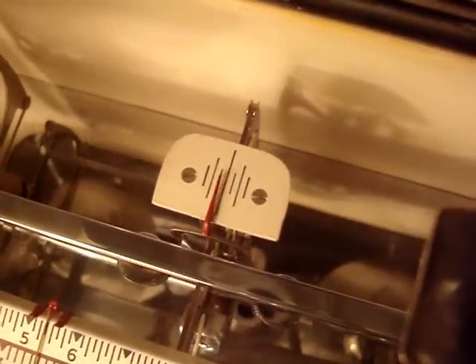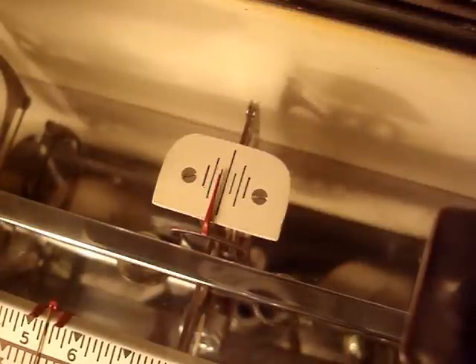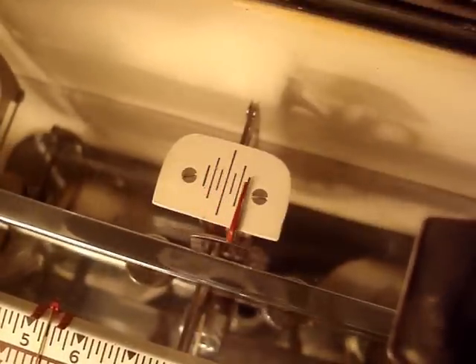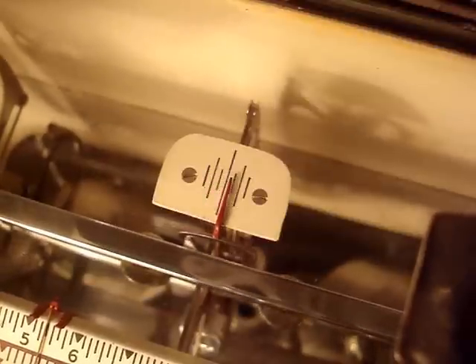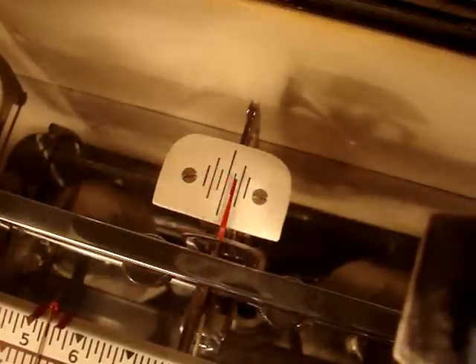So this is what the scale looks like when it's in motion. Let me just touch this beam here a little bit. Yeah, look at that — there's a piece of paper on there, so you can see the motion of the needle. And that's what it looks like. This thing is impossible to light.